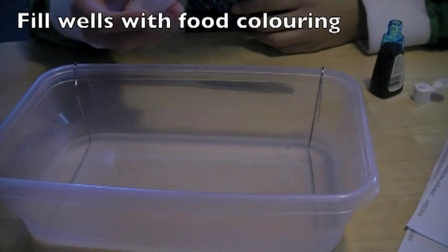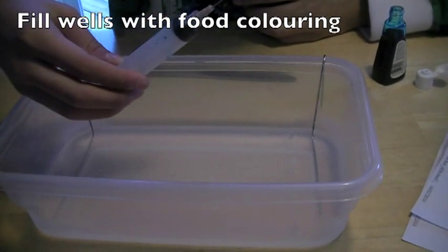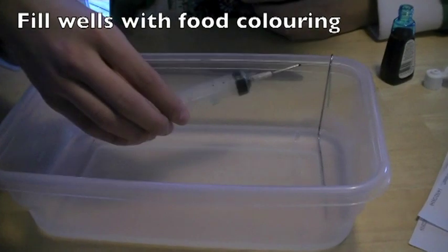Using a plastic syringe or medicine dropper, fill each well in the gel with a different color of food dye. A small drop of food coloring dye is sufficient.